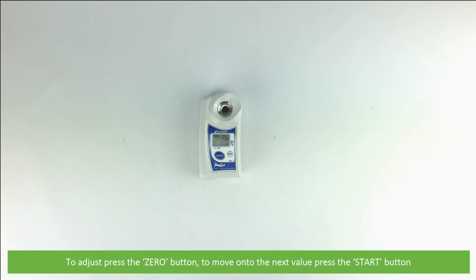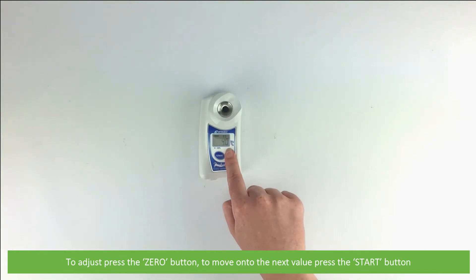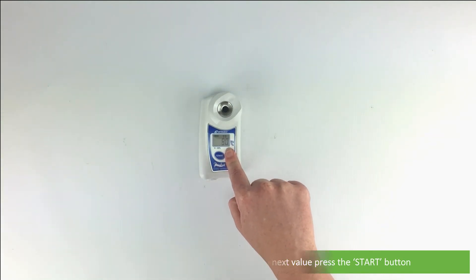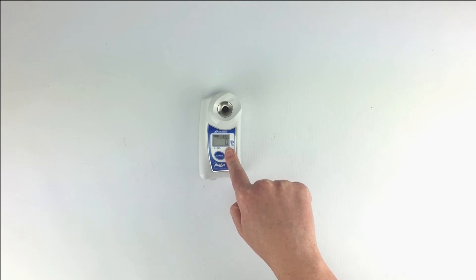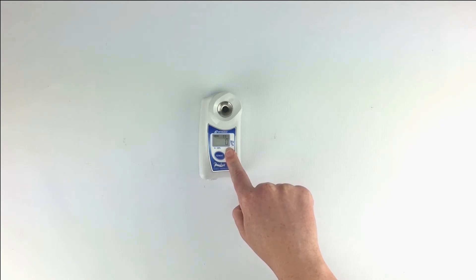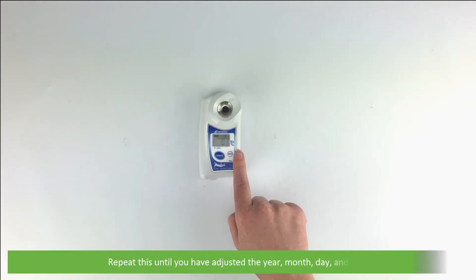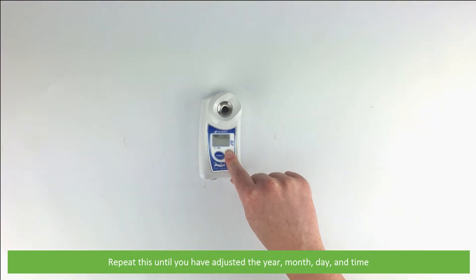To adjust, press the zero button. To move on to the next value, press the start button. Repeat this until you've adjusted the year, month, day and the time.